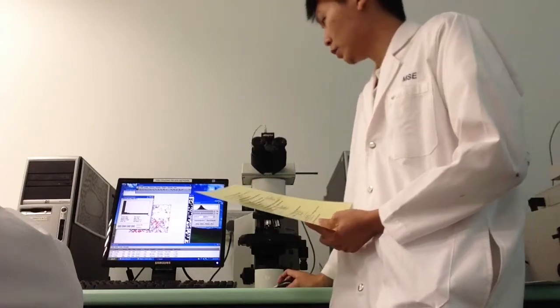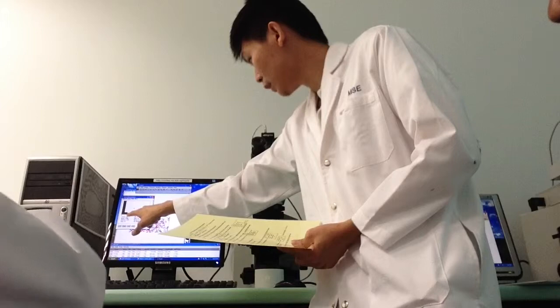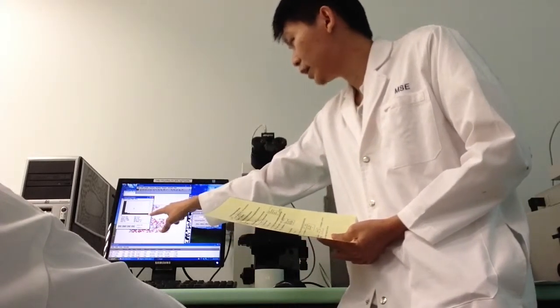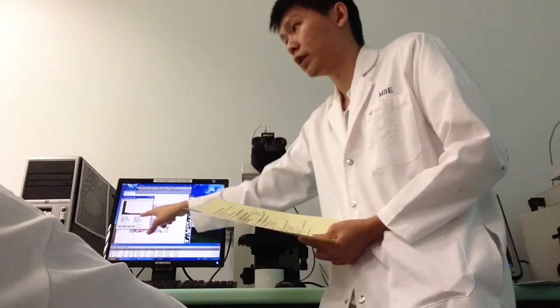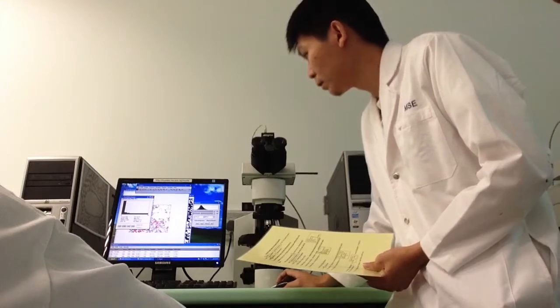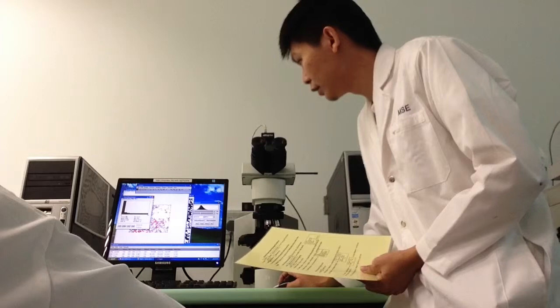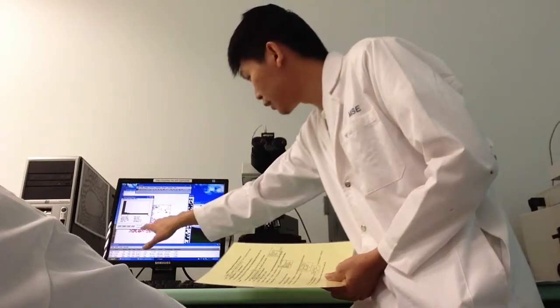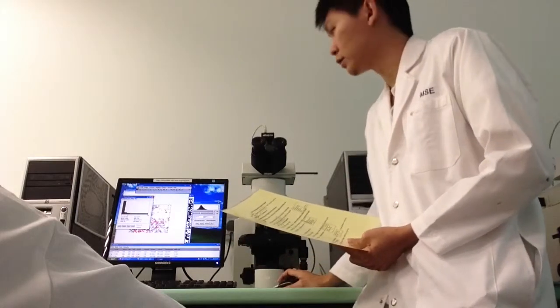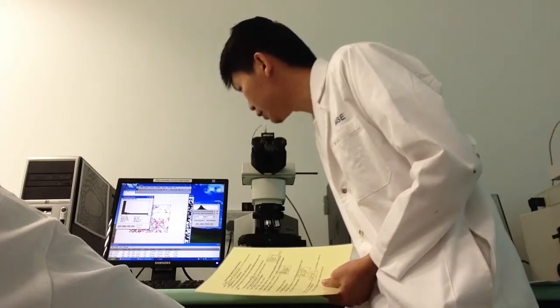Okay. So what you can see over here is that from this point onwards is perfectly flat, which means that there's no data over here. So what you can do is place your cursor below the last bar. Okay, this is the last bar. You can see that there's a value here that always changes when you move the cursor. So you take note of that value.